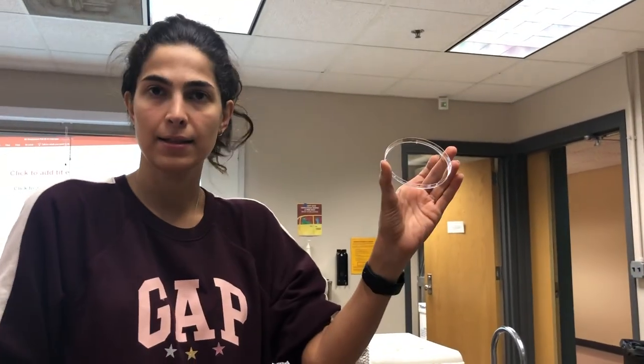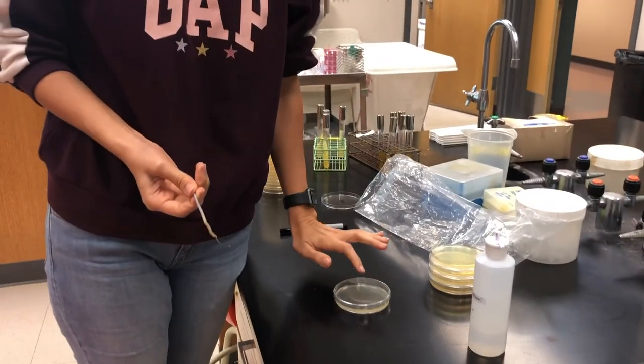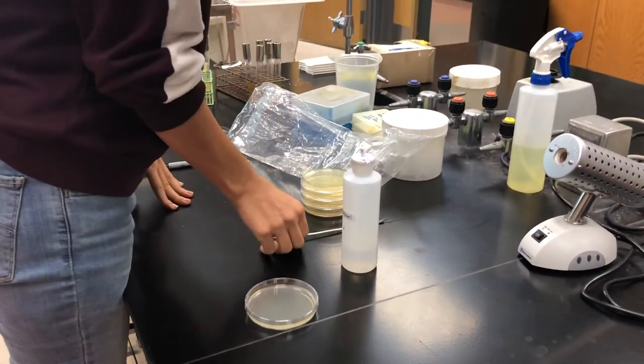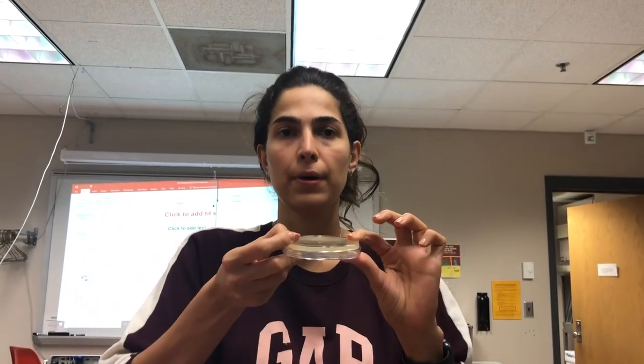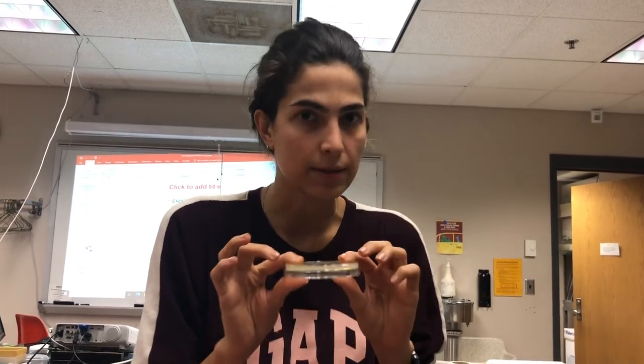The plate got contaminated so I will use another lid in order to follow aseptic technique. We will put the plate other side up in the incubator at 30 degrees for two days, and then I will show you what the results look like.